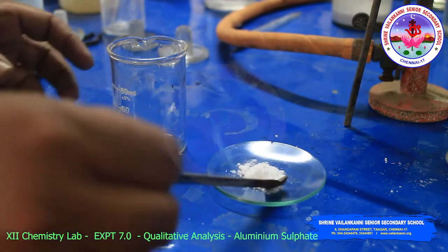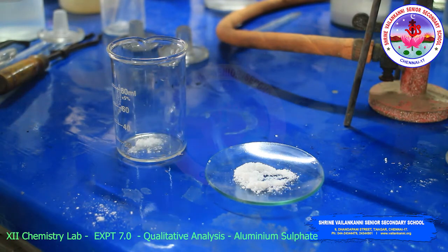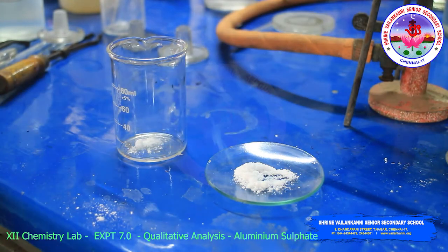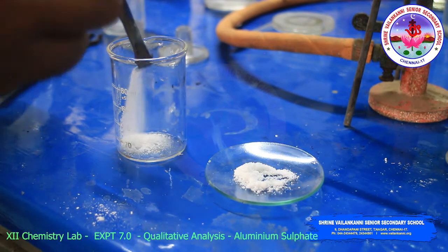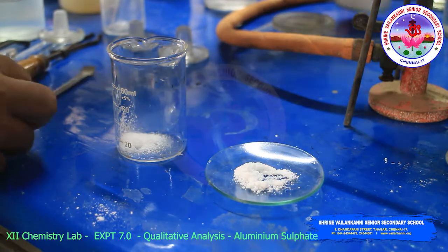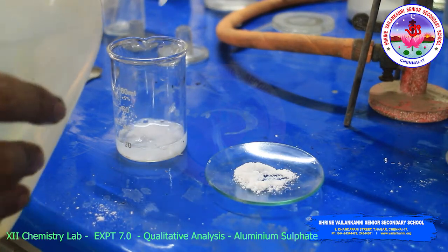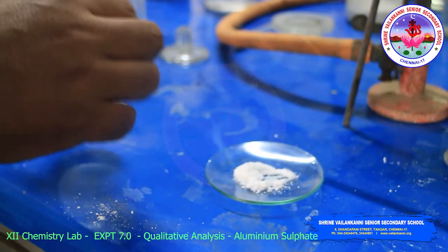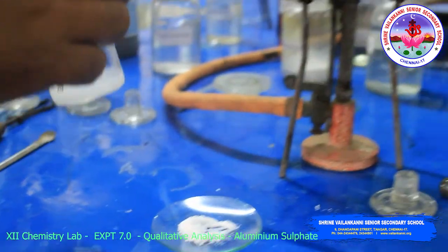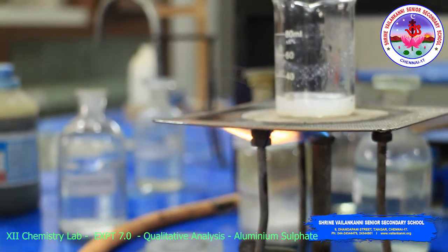Take a small amount of the substance and add twice the amount of sodium carbonate, dissolve the substance with the help of water, heat it, cool and filter.